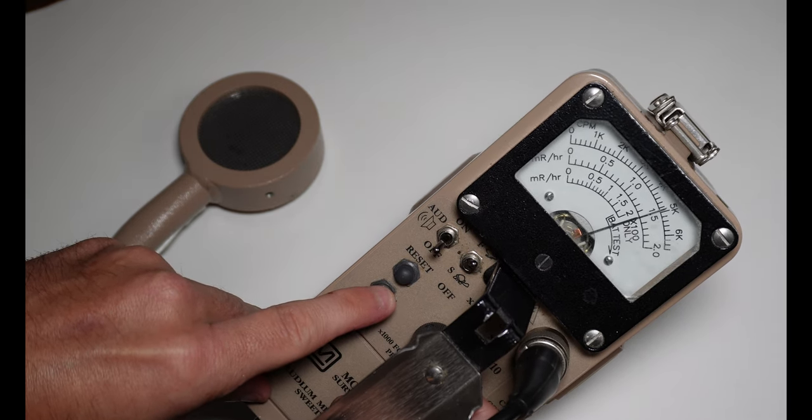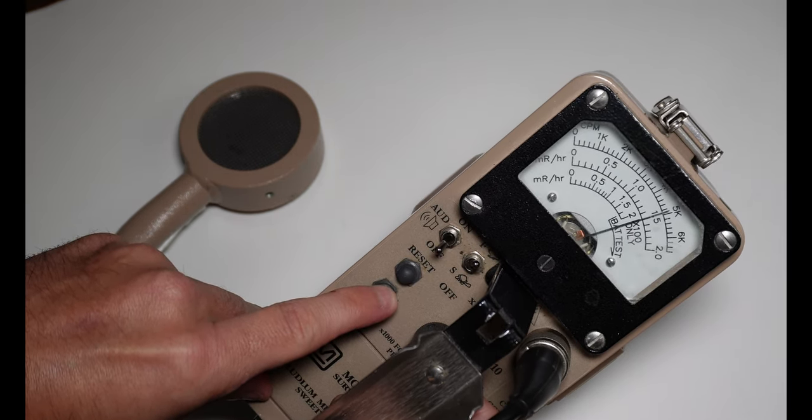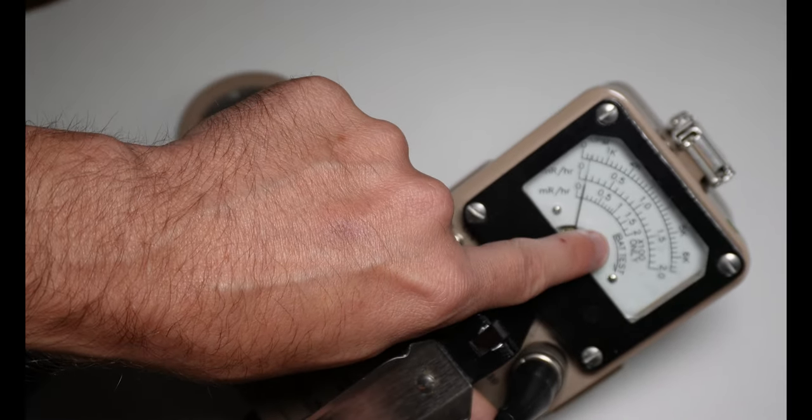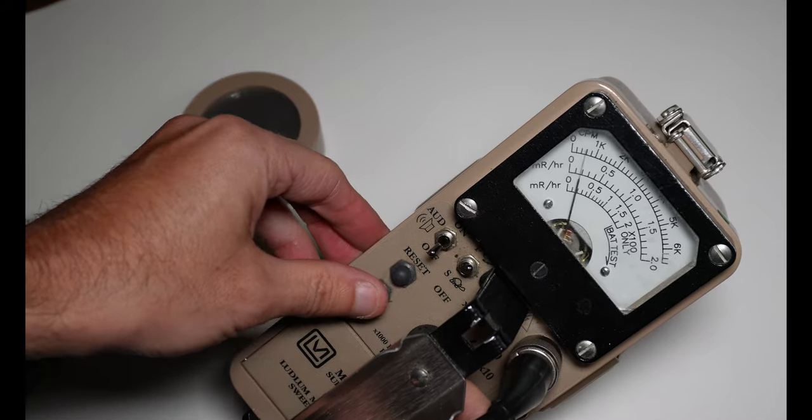We've tested the battery by depressing the battery button and looking to make sure that we stay in the battery test range up here. So our battery is good.